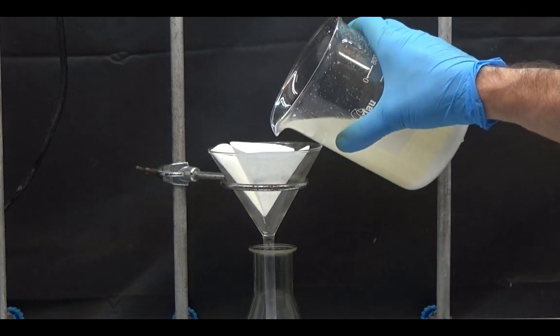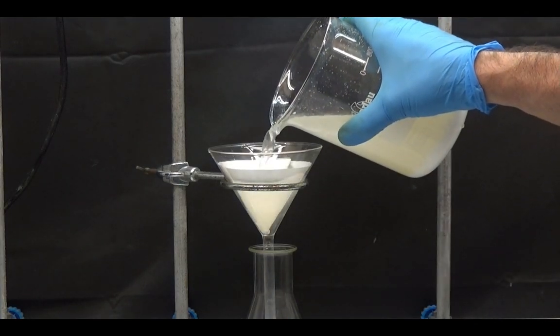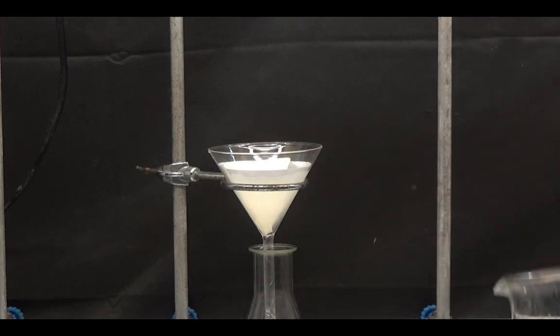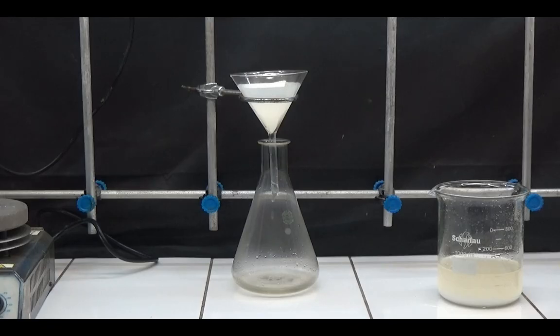The sodium mucicate solution has a yellow color. To purify it, we first filter it to eliminate the product that is not soluble in sodium hydroxide.